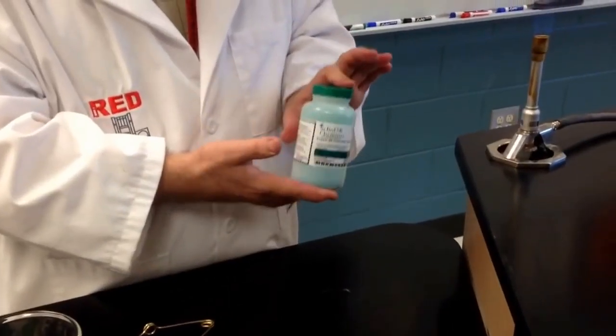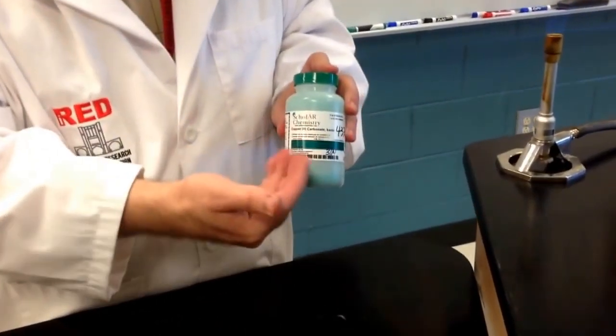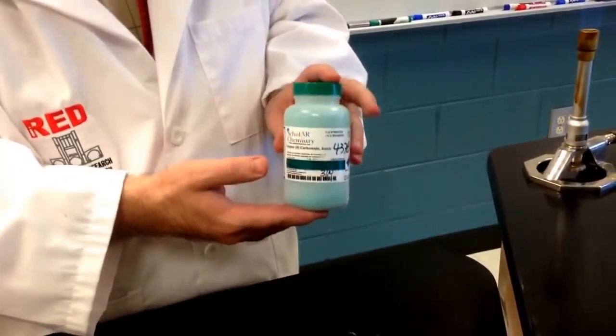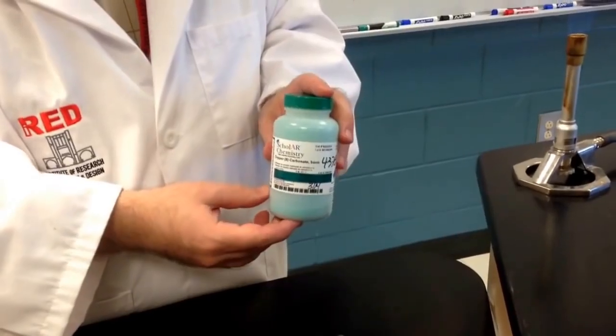This is a demonstration of the decomposition of copper 2 carbonate. It's decomposing, or will decompose, into copper 2 oxide and carbon dioxide gas.